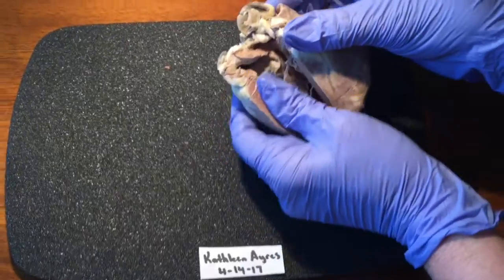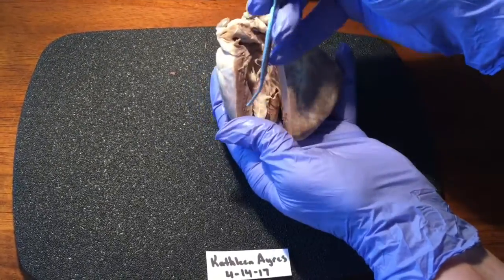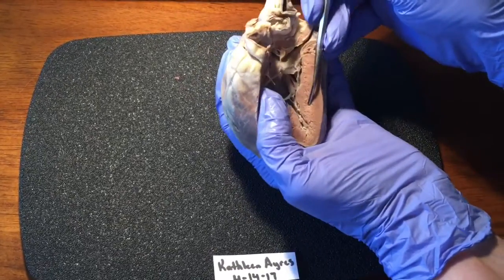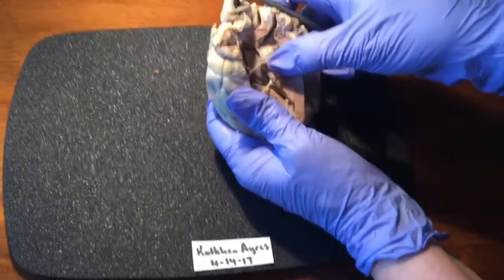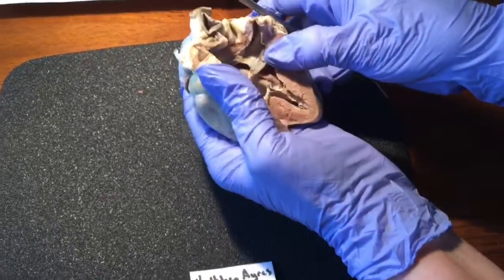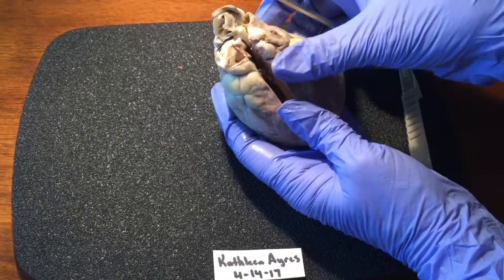The myocardium of the right and left ventricle. It's the right ventricle myocardium, left ventricle myocardium. And the reason the left is so much larger is because it pumps to the largest of the arteries in the body, and it's a muscle, so it's larger. The trabeculae carneae on the inner surface of the ventricle.